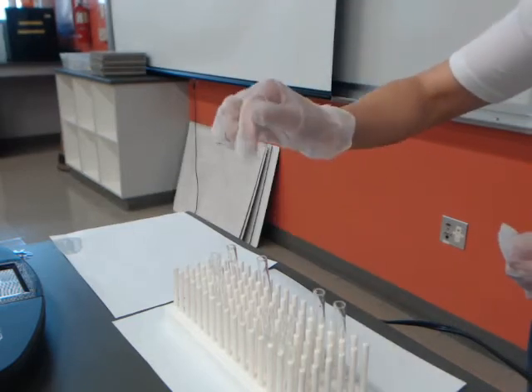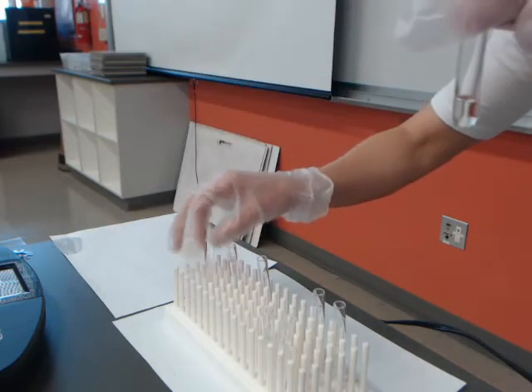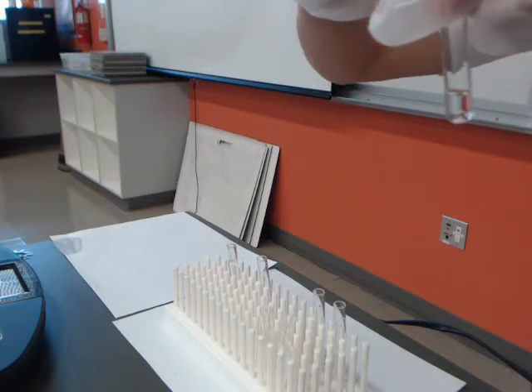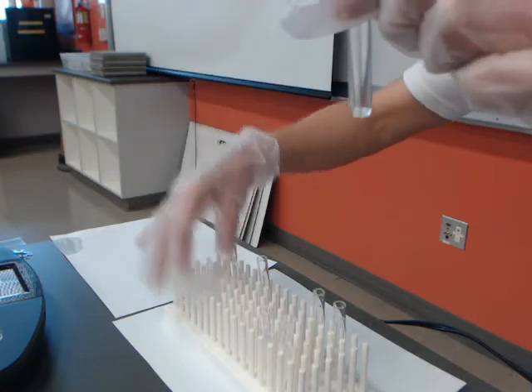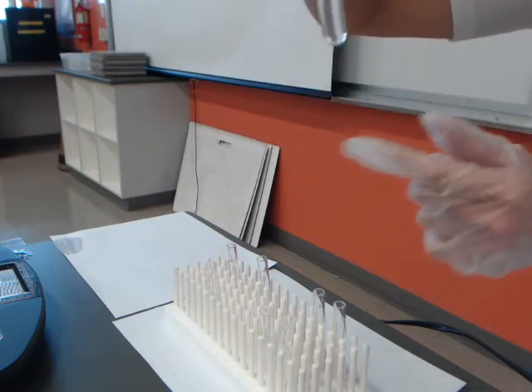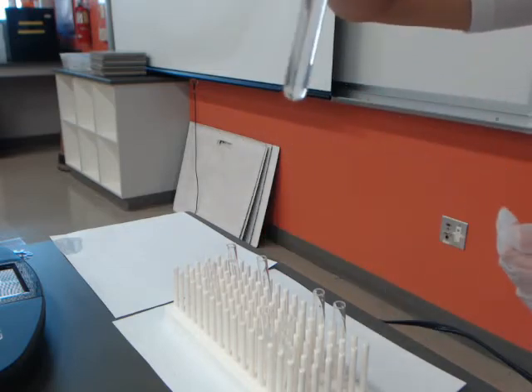And then if we go to test number 3, where we've got some ethanol in a test tube, and then we're going to mix the ethanol and water. So I'm going to pour water in. And I can't tell where the ethanol is and where the water is. Looks like they've mixed uniformly.